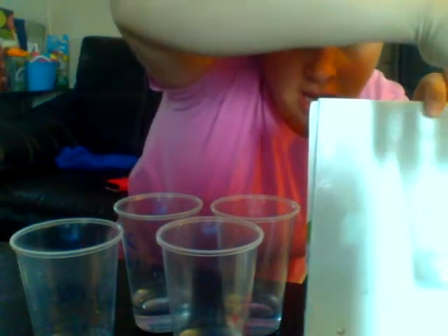So let's start with ammonia. Again, it does make it fairly light. I'm trying to get the most in the camera here with the cup, and the way the light's hitting us. So we're going to pull them up as I do. And again, here's the cup that we're going to do the ammonia.